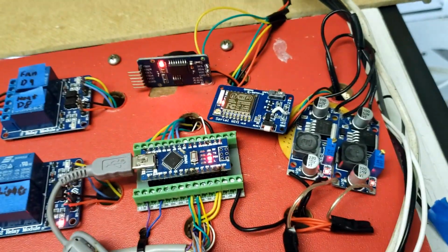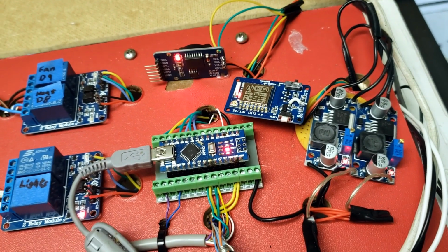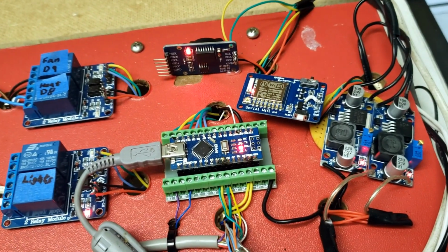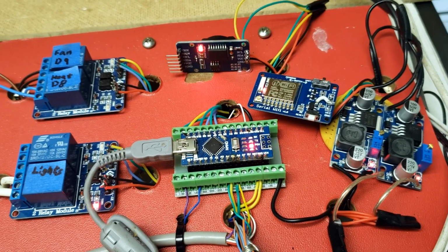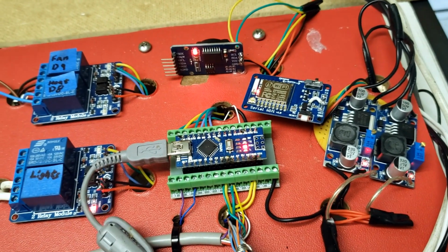Next, we have the power regulators. I have a 5-volt and a 12-volt, and the 12-volt powers the fan. The 5-volt powers everything else. So the Arduino can't power everything. There's just too much going on here for it to power 5 volts on its own. So this provides power to everything else.